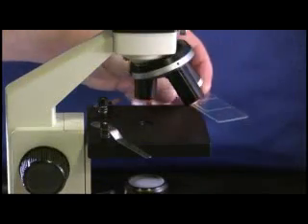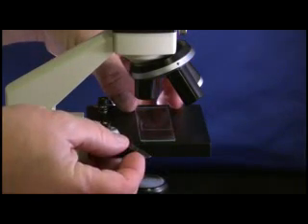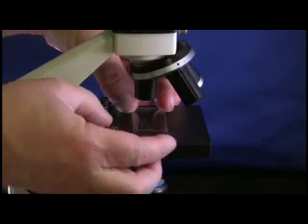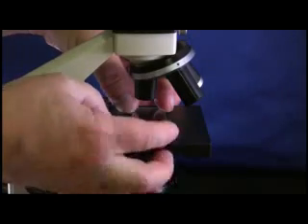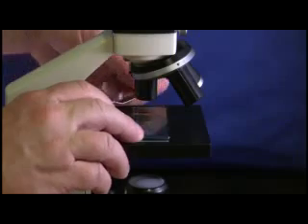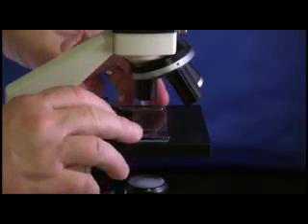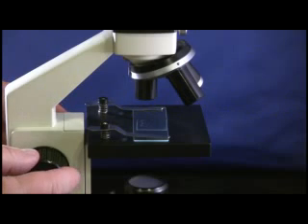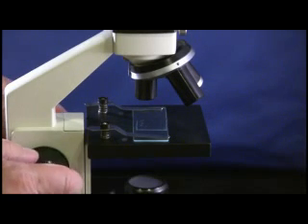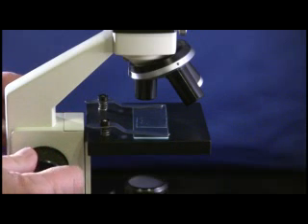Place the microscope slide onto the microscope. Adjust the drop so it's under the lens. Hold the slide down with the slide clips. Start with the lowest power objective lens first, and while looking from the side, crank the lens down as close to the specimen as possible without touching it. Now, look through the eyepiece lens and focus upward only until the image is sharp. If you can't get it in focus, repeat the process again.